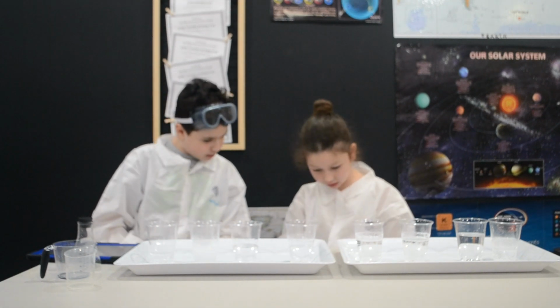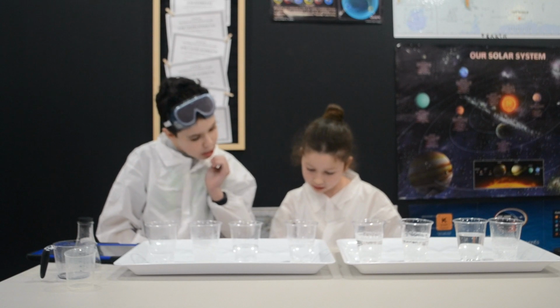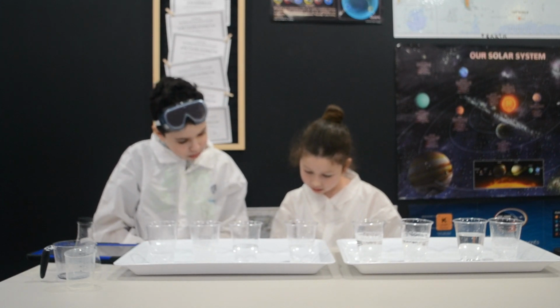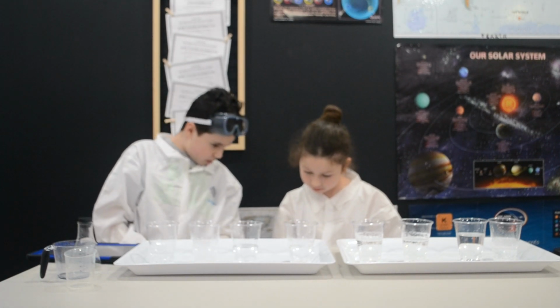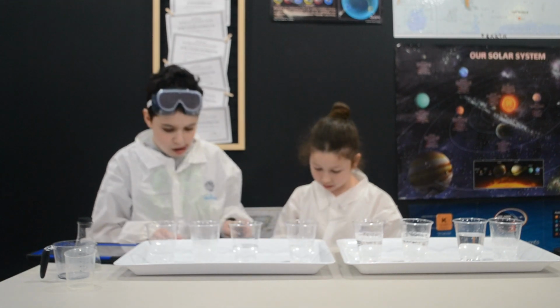55.90 seconds. So it's this one? Yeah. 55.9 seconds. This is this one.